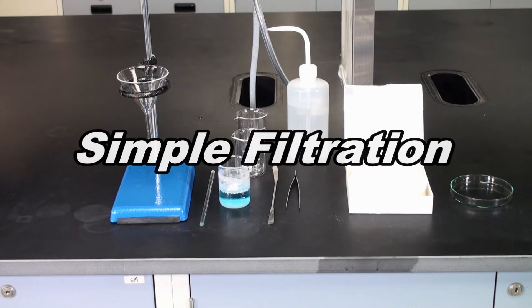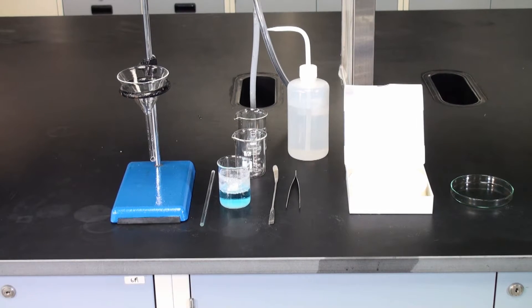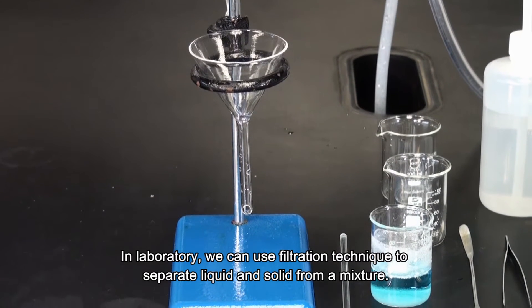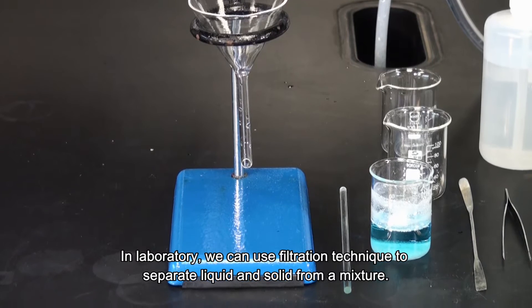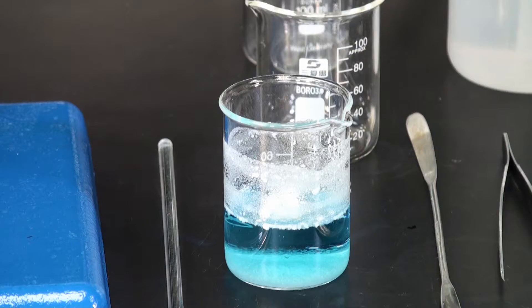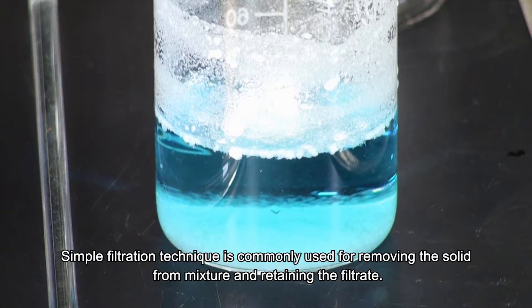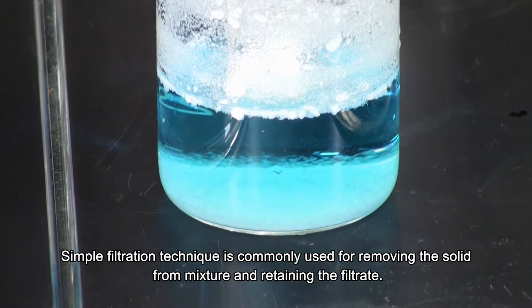Simple filtration. In laboratories, we can use filtration techniques to separate liquid and solid from a mixture. Simple filtration technique is commonly used for removing solid from a mixture and retaining the filtrate.